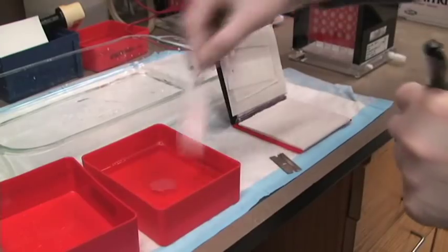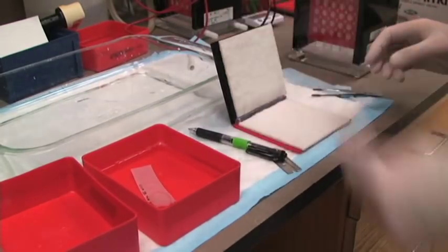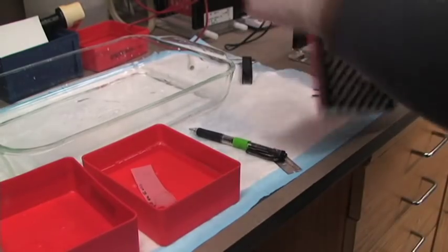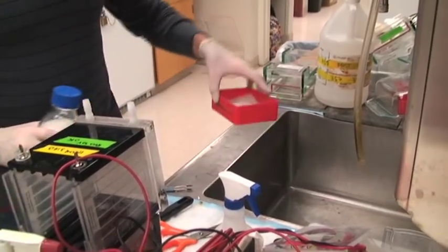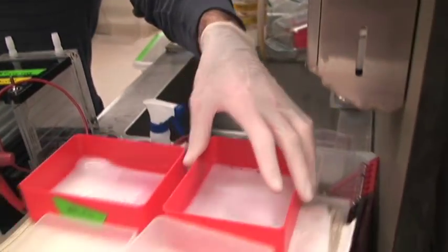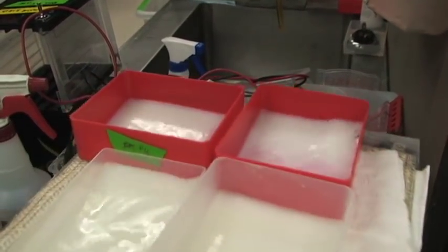Now before Larry incubates his membrane with antibody, he's going to wash it and then put it in a blocking solution made of milk, and this will prevent nonspecific binding of the antibody to random proteins. Fifteen minutes, half an hour, or something like that.